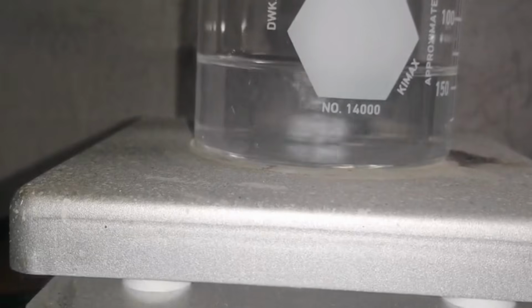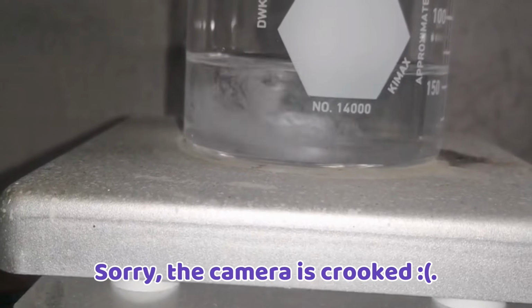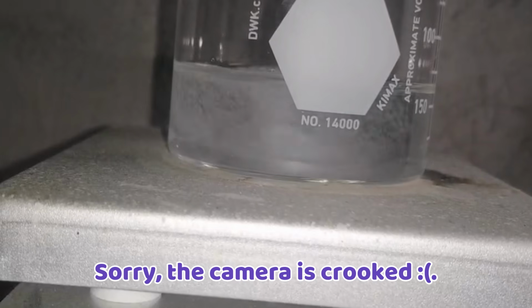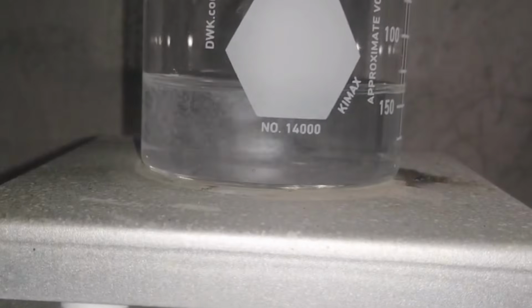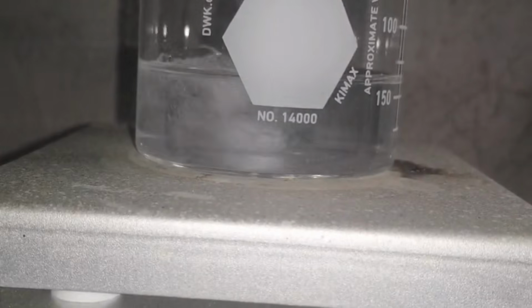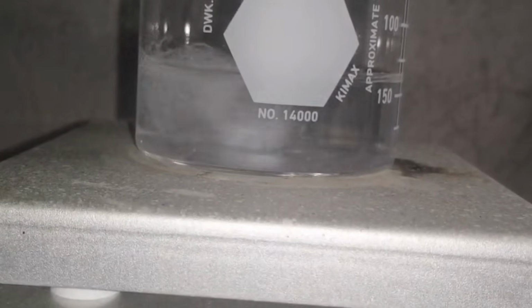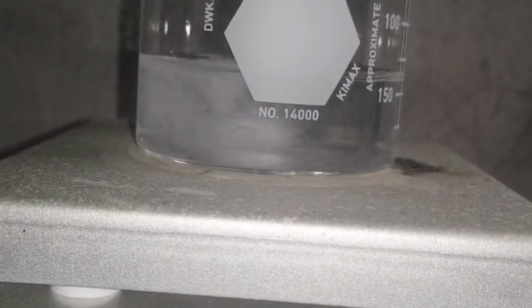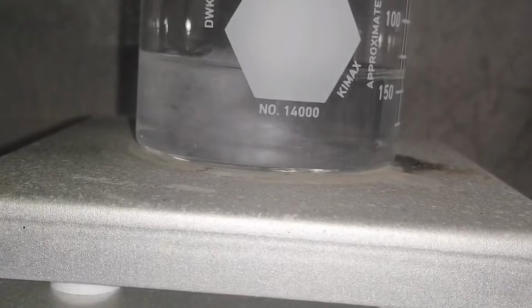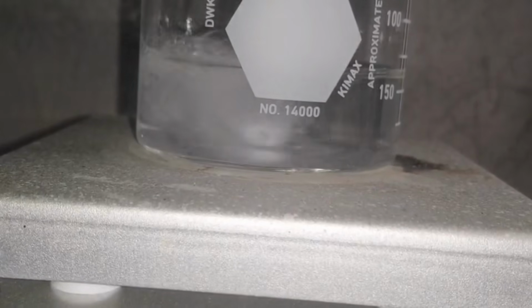Once the sodium bicarbonate is completely dissolved, we just need to pour the nitric acid into the solution. This addition must be done very slowly to avoid any accidents. You will immediately notice some bubbles forming in the solution. This happens because carbon dioxide is forming and escaping, which gives us that nice effervescence.